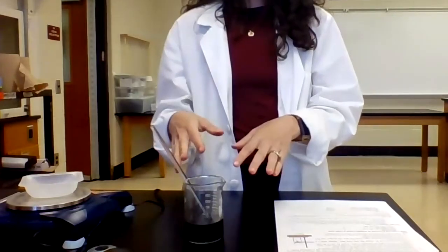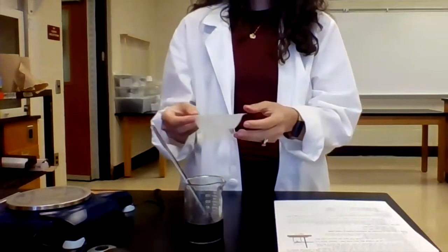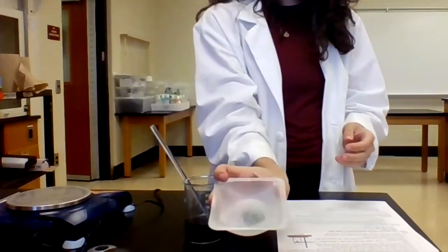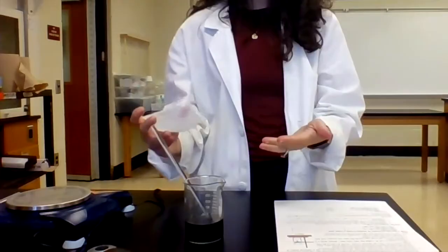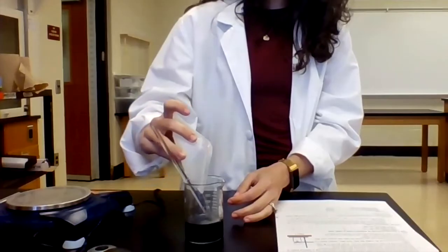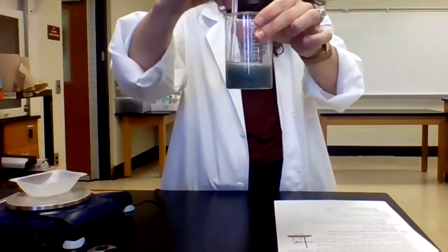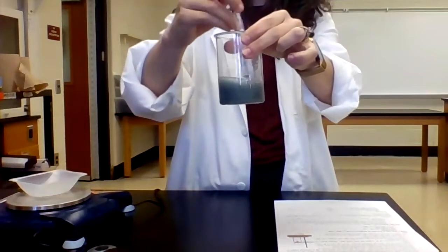All right, so now that I've dissolved my copper oxide in the water and the hydrochloric acid, I need to add my zinc to cause the reaction to happen. The zinc is going to react with the copper oxide and reduce the copper to copper metal. So here is my 3 grams of my zinc. I want to add this carefully. Hydrogen gas does get produced here, so that's why we need to make sure there's no flames around. Just make sure we get it all in there. So we can see and hear bubbles that are forming, right? That's the hydrogen gas.